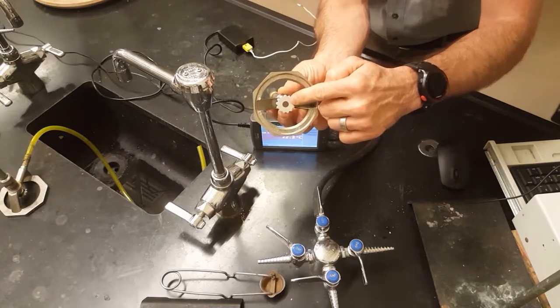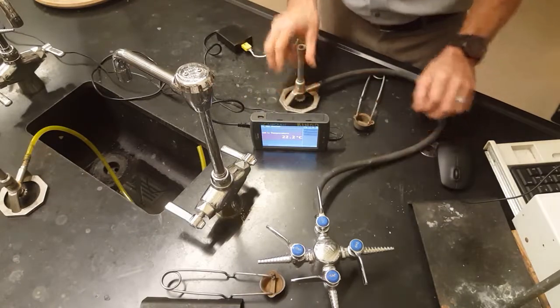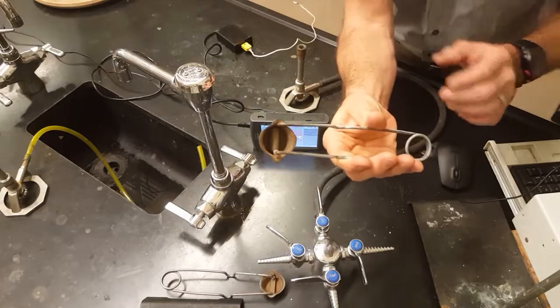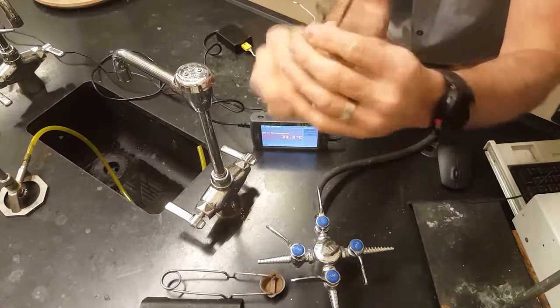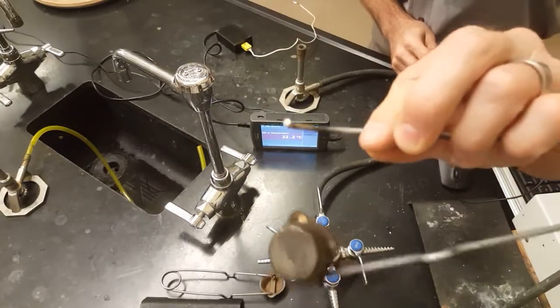This is your striker. You're going to twist it and it will push a flint into the striker plate.